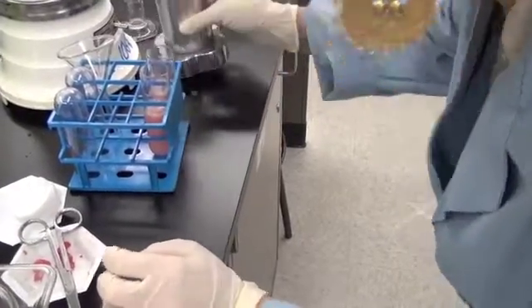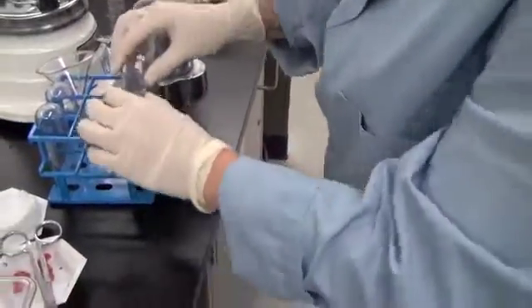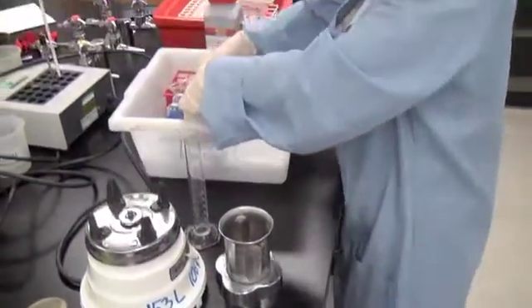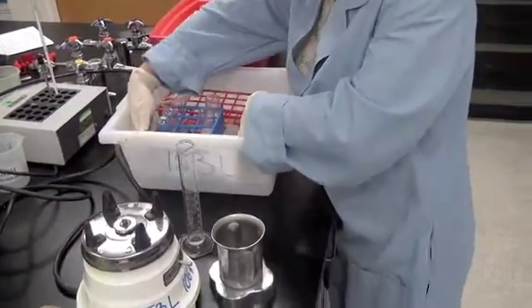Oh, and Biochemist Dicer doesn't look like she has any of that nasty stuff. That's correct. She probably shook around the blender cup between spins, and it looks like her complete cutting beforehand did the job.